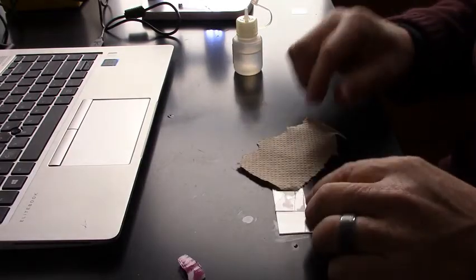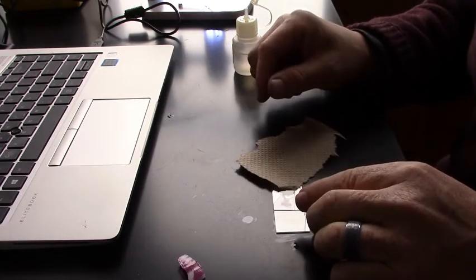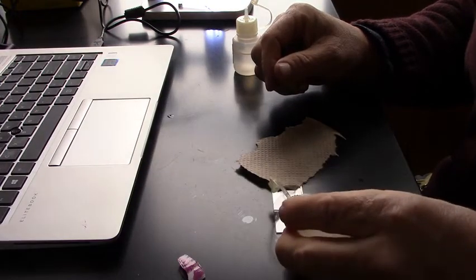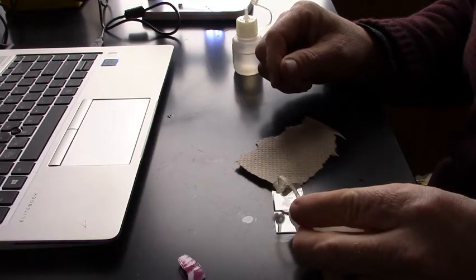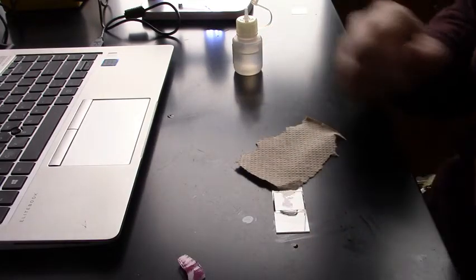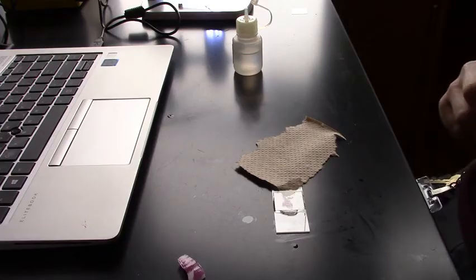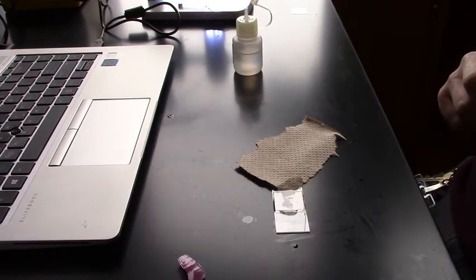And what I'm going to do is drip a couple drops on the opposite side of the cover slip. And that paper towel is going to wick the tap water off the slide, pulling that salt water across that slide. So what you're actually going to see is me do this under the microscope in just a second.